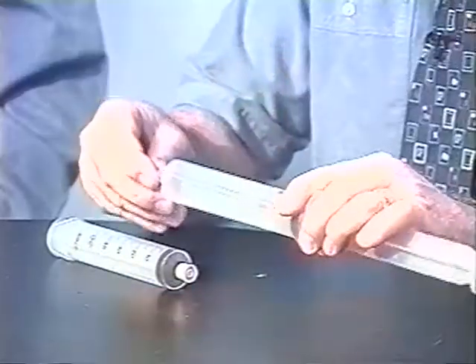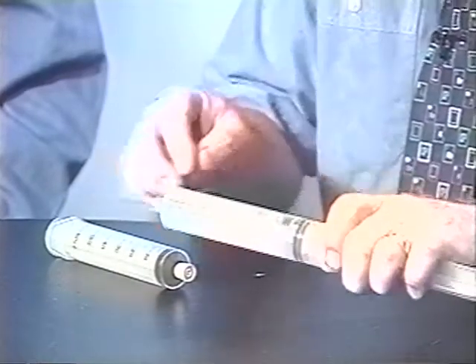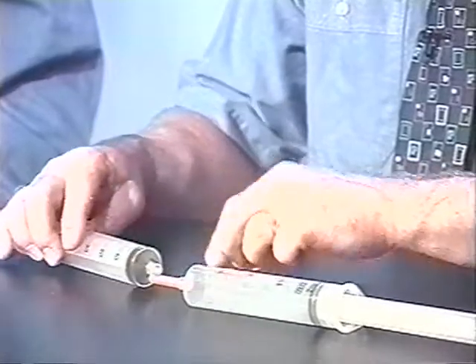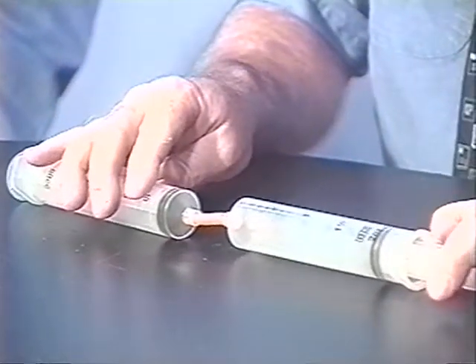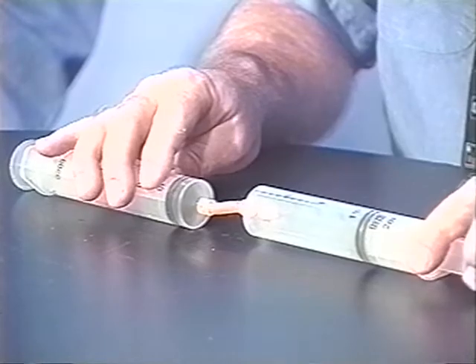Any gas works. The heavier the gas, the better the results — hydrogen gives the poorest results. We'll do a syringe-to-syringe transfer using a short length of latex tubing, clean out the latex tube with some of the gas — providing it's not a noxious gas — and then transfer the gas to the molar mass syringe.